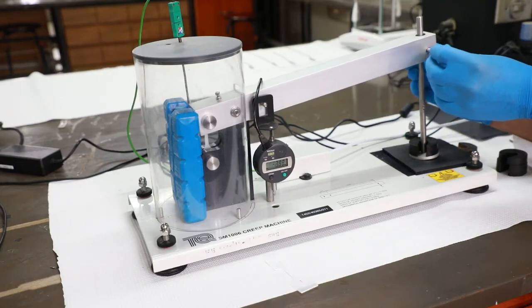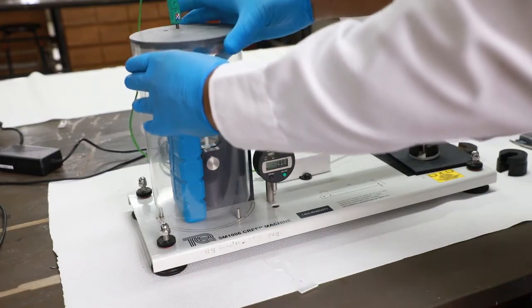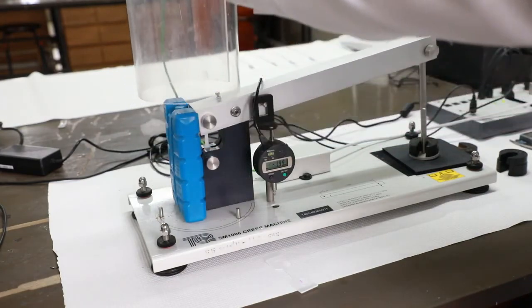Stop recording after 10 minutes and remove the cover from the apparatus and remove the sample from the pins.